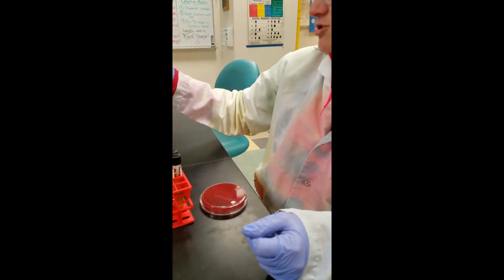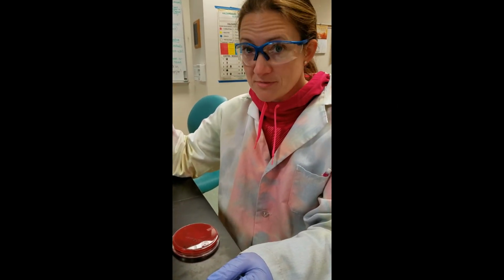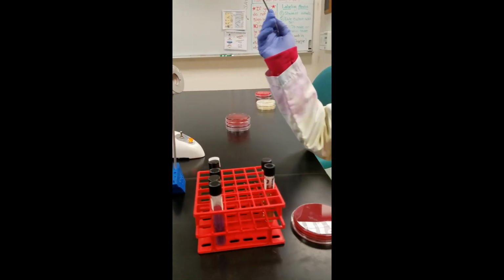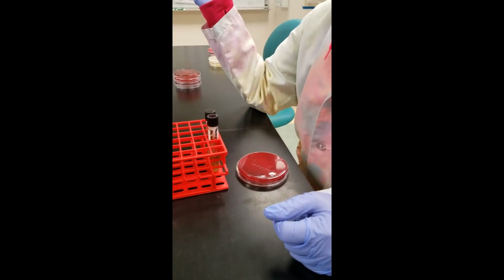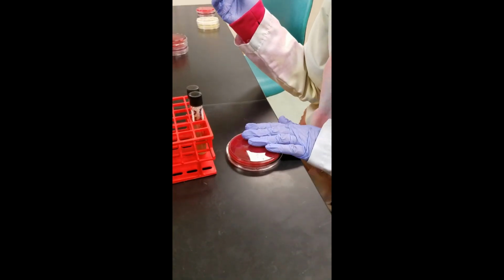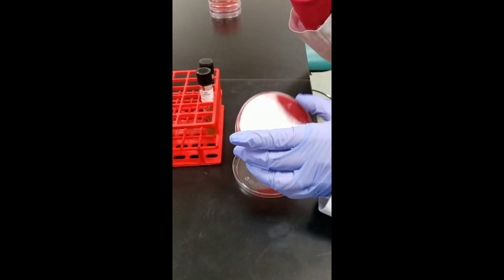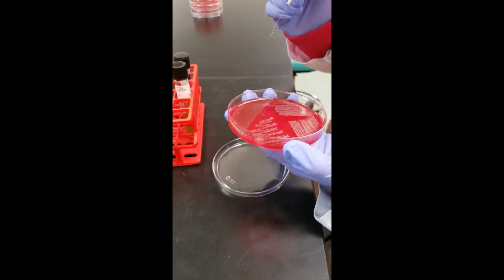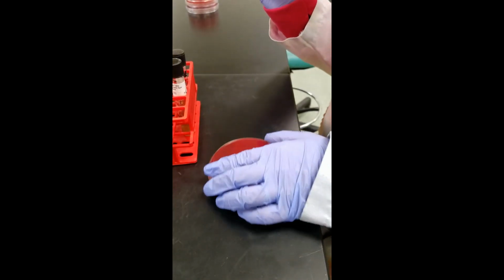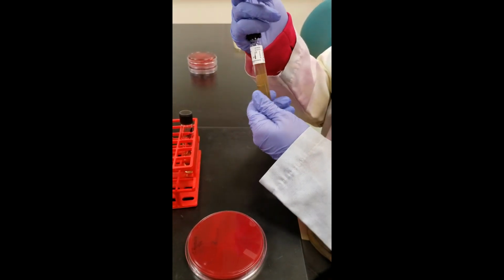Our last tubes that we're going to set up are going to help us narrow down enterococcus from streptococcus bacteria. Again, they're both gram-positive, they are both cocci shaped, and they're catalase negative. So this is a test to help narrow down that it's an enterococcus and not a streptococcus. I do have a plate of enterococcus bacteria, and I'm going to inoculate two tubes, a bile esculin and a sodium chloride broth. So I'm going to pick up some bacteria, so I know it's an enterococcus, and our test results will show us enterococcus positive results.